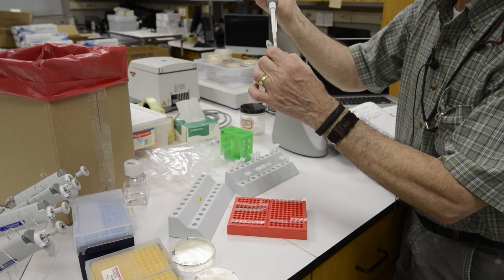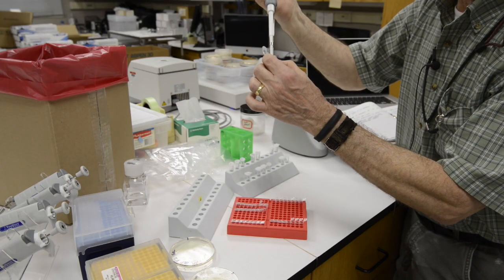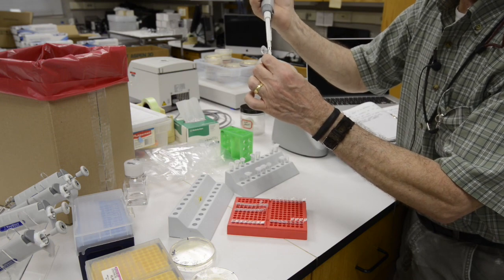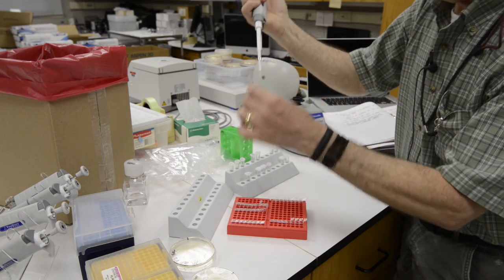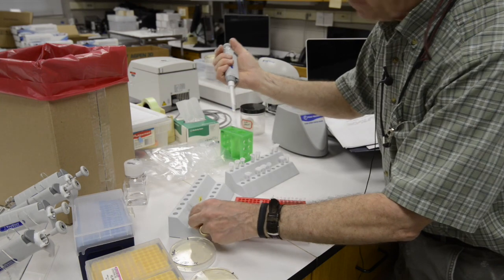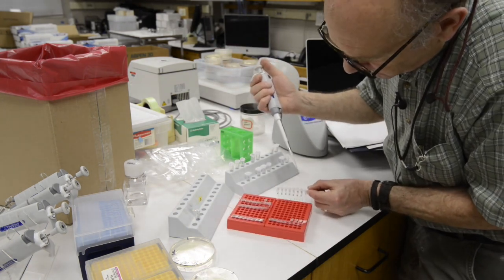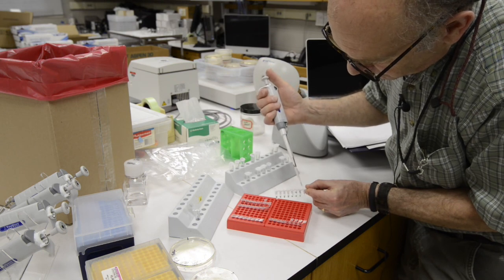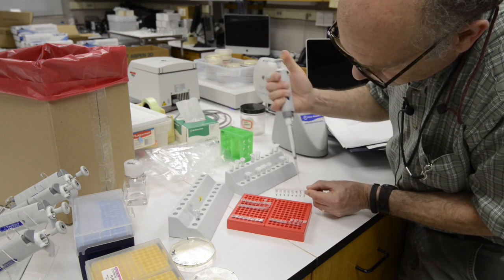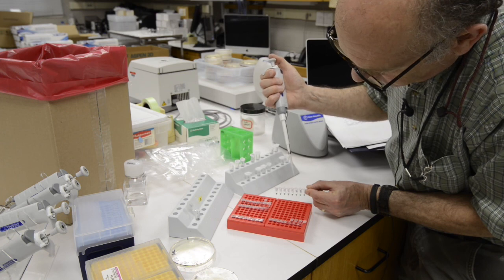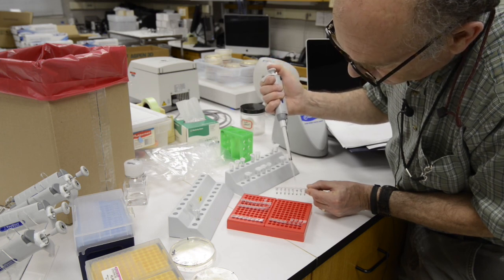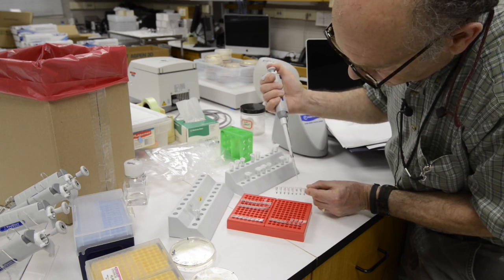Now you should immediately pull 11.5 microliters of that bacterial suspension, that mixture of bacteria and molecular grade water. Pull 11.5 microliters and put it into one of the PCR tubes that's marked for that particular sample. You're going to repeat this process for each of the samples that you're preparing.